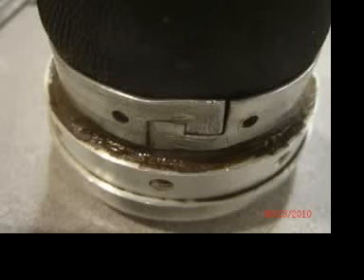Now you move them back into position. I used a pair of needle nose pliers, and once you've got them in this position, you're good to go. Try to avoid bending the clamp ring any more than you have to. This clamp ring has been taken off of this particular core holder a number of times, and consequently it shows its rough life.